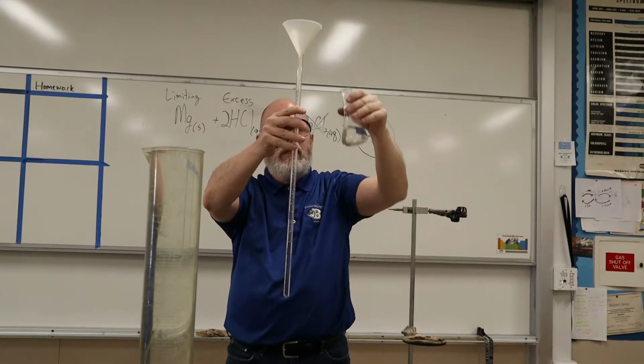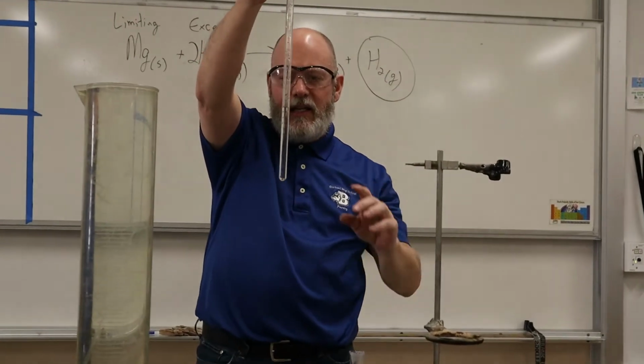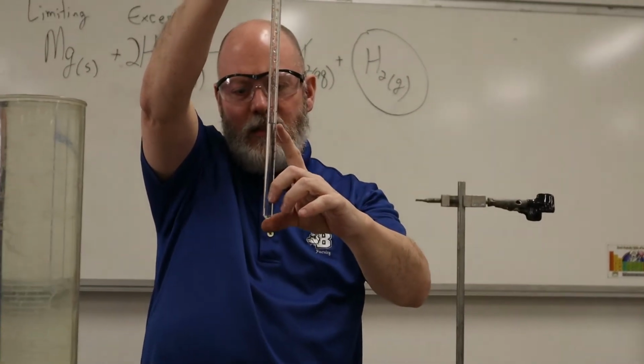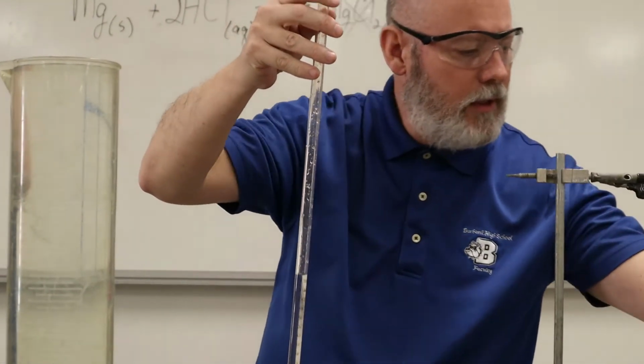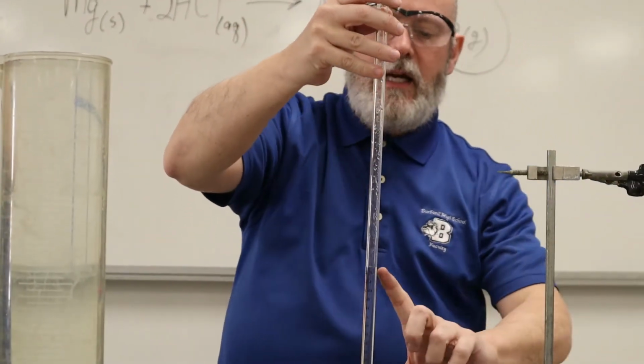Okay, so there's about 10 milliliters right there. As long as it's 10 or a little bit more is fine. You know you have enough to completely react the magnesium. All right, so put that away. All right, so we got our acid in here.